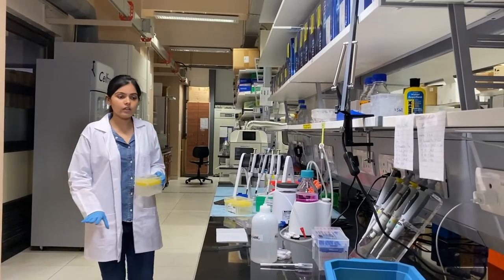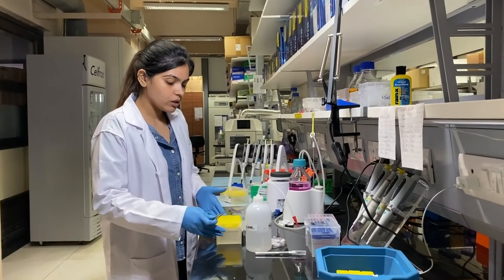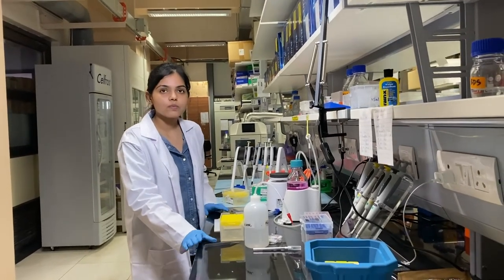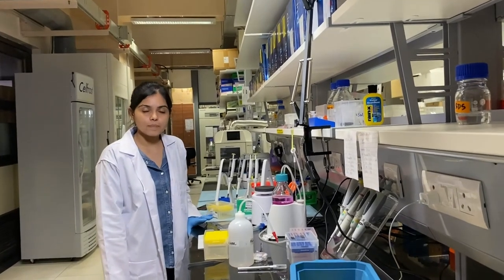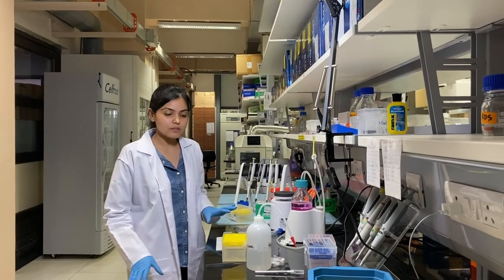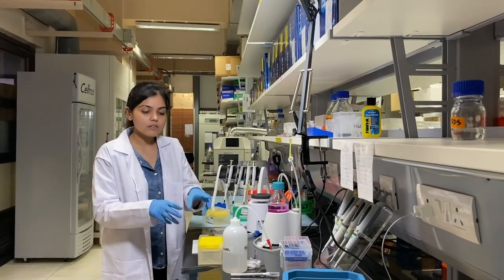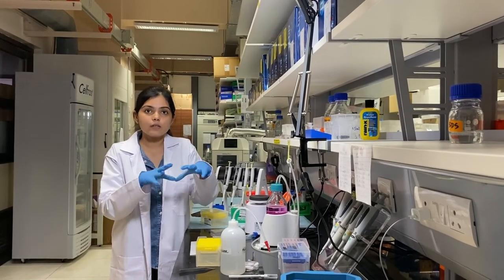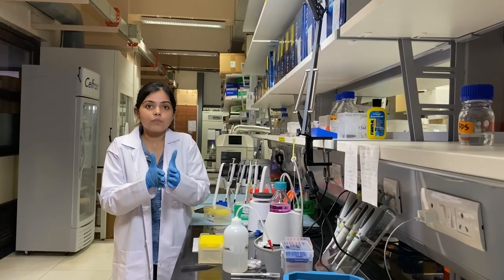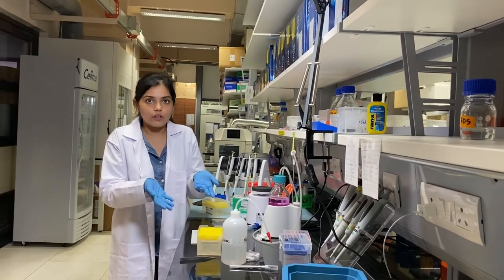After one hour, the gel has polymerized and contains our sample. Now we homogenize before adding water and expanding. If we just added water now, the gels would expand, but the problem is that cells have areas of different densities — some parts would expand faster and more than others, giving uneven expansion.